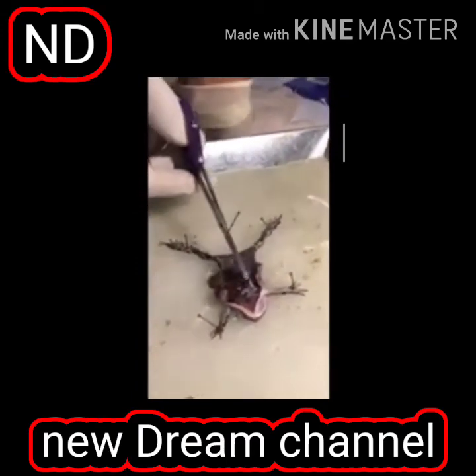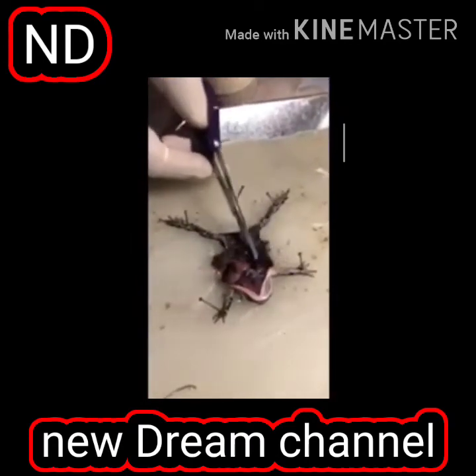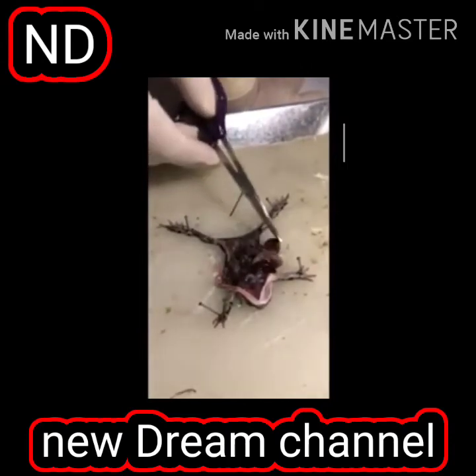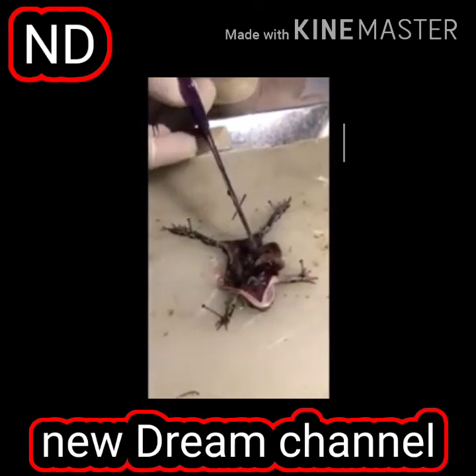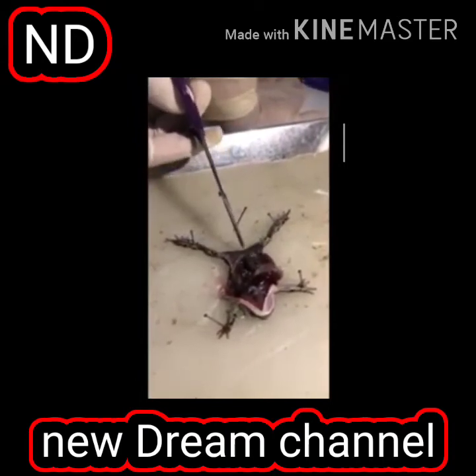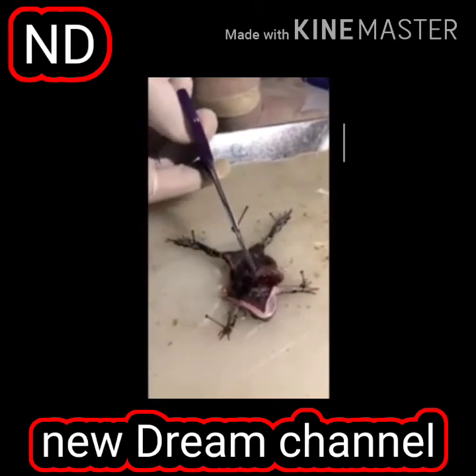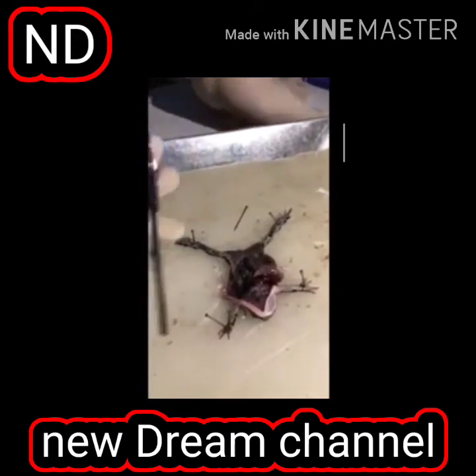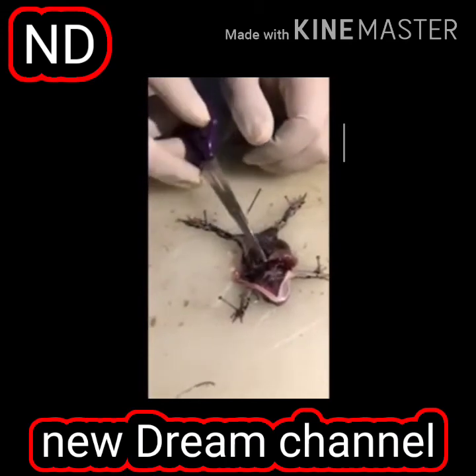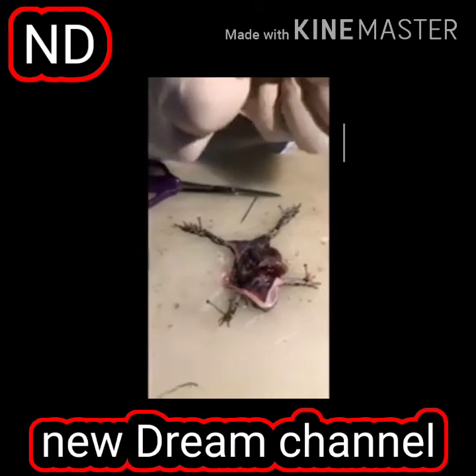Heart is still beating. So this is the liver. It shows pulmonary respiration. As we studied in the class, they show pulmonary respiration. These are the intestines, and then it will end in the cloaca here, and it will defecate material here, and this is the heart. And you see the other lobe of the lungs. Do you know what happened to the lungs? Because air is not present, it got collapsed. It was spongy, it got collapsed.